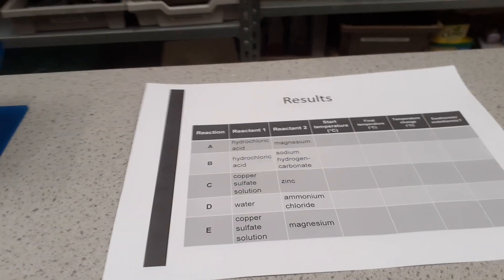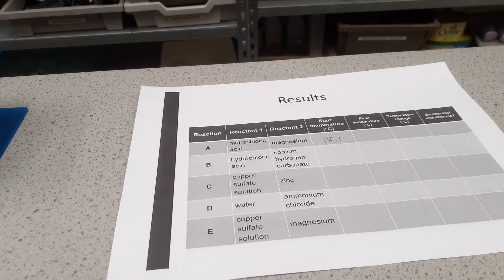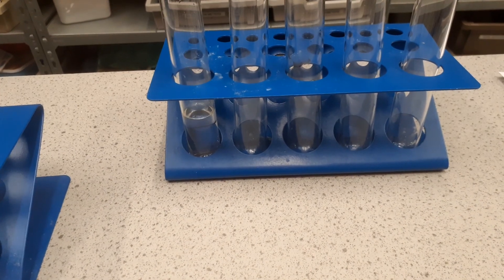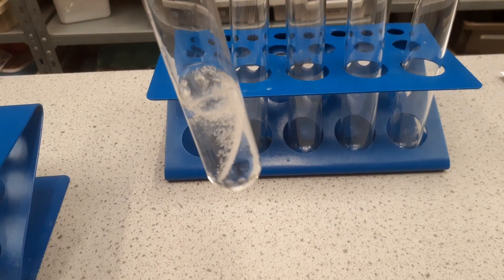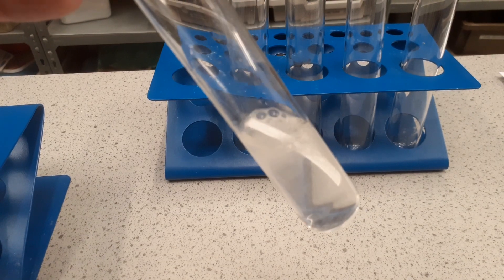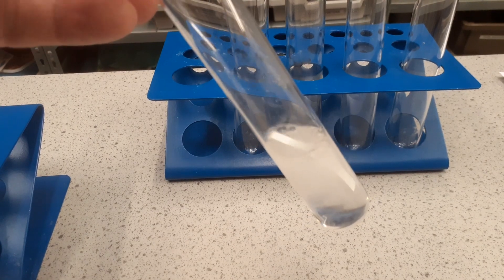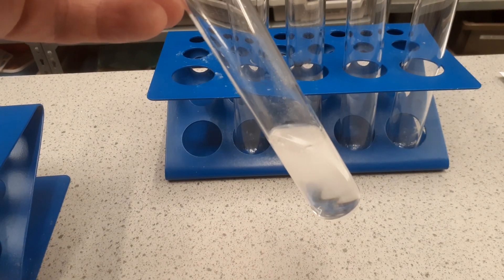I'll record my results in this table and you can record them in yours. I'm going to add the magnesium now. As you can see, there's a reaction occurring between the magnesium and the hydrochloric acid. It's fizzing quite strongly because, as we know, an acid and a metal gives us hydrogen and a salt.